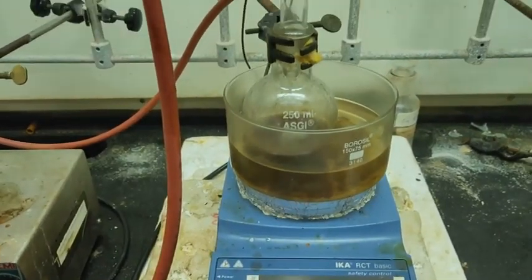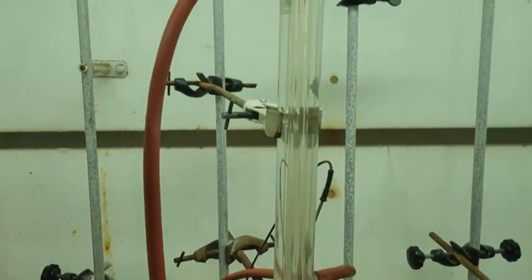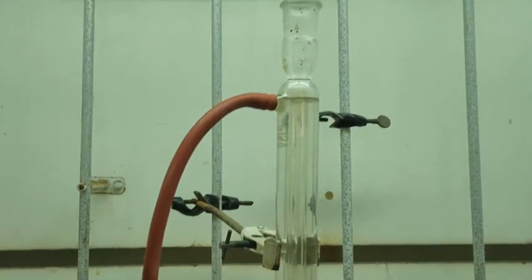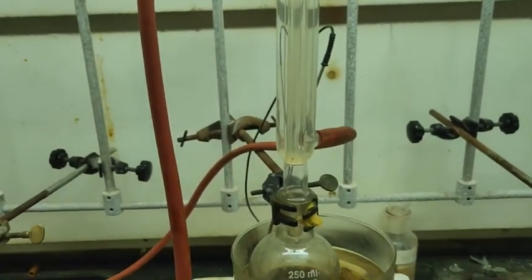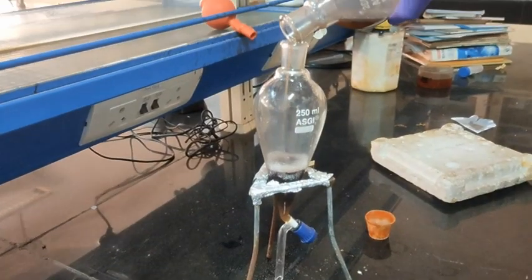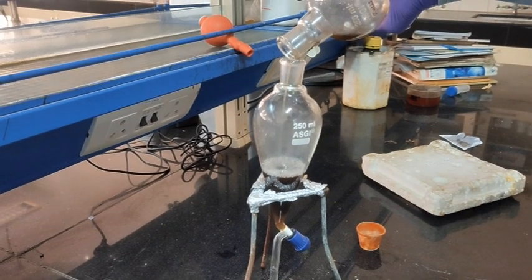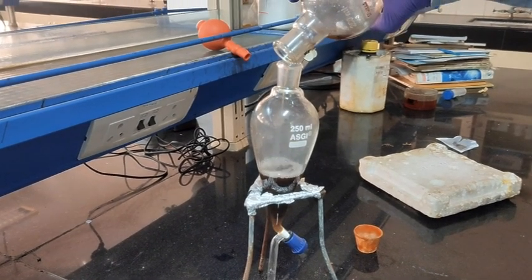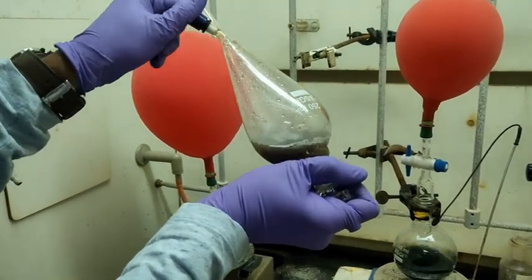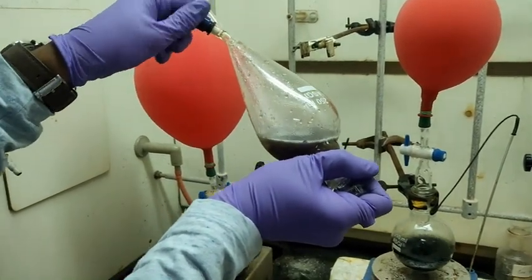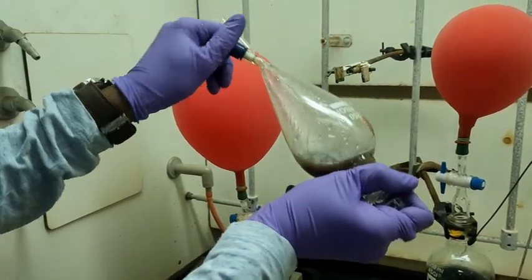Reflux for one hour at 110 degrees Celsius in an oil bath. Cool the reaction mixture and add 15 mL of 3 normal HCl and mix. Transfer into a separating funnel. As a precaution, while mixing in a separating funnel, release the gases produced by venting them at intervals.